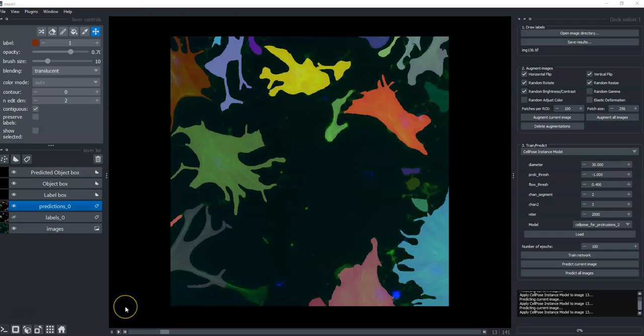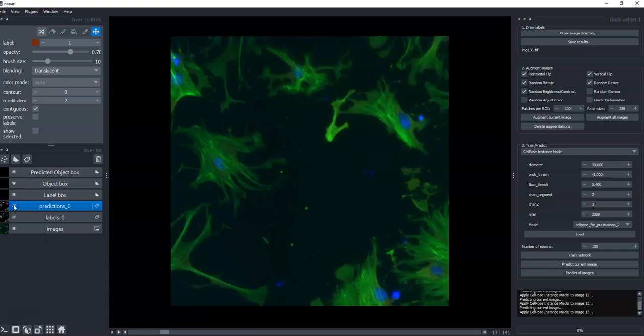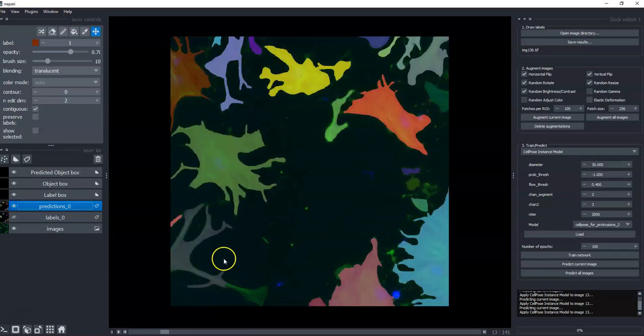Okay, so here is part two of the challenging Cellpose problem. I've been scrolling through and looking at a few different images and trying out the model I trained on them. It's actually not that bad in a lot of cases. But there's a few weird things, like for this image here, I have not been able to detect the whole cell, and even increasing the number of iterations really high doesn't seem to help. So I might, in a moment, look into that case in a little more detail.